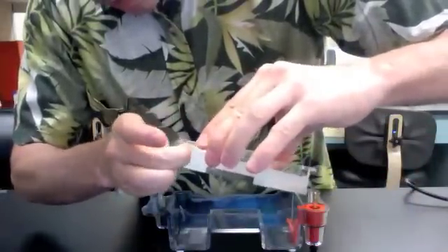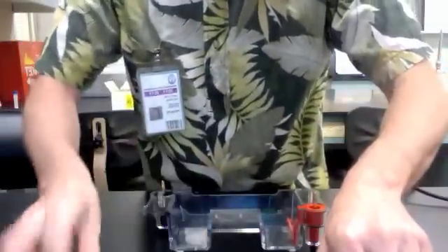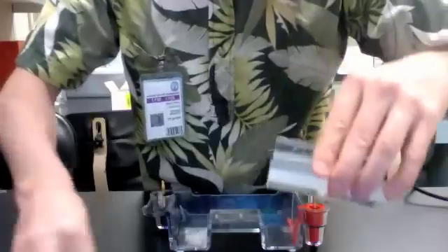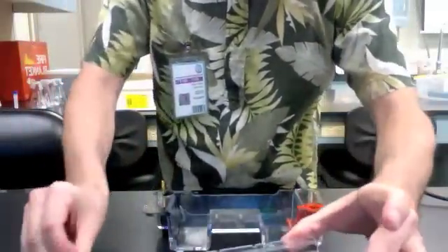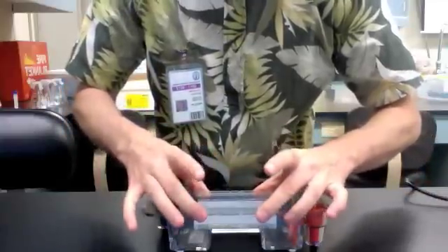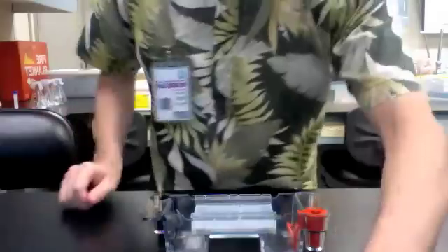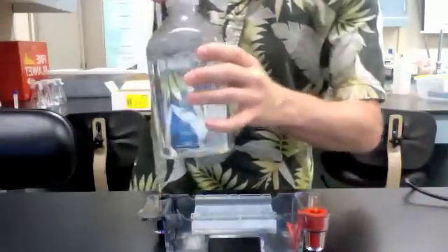This may seem tedious, but by taping it up very well, you made sure that it didn't leak out all over the place, which is important. All the tape has been removed. Now you don't have to take the gel out of the container—you simply place the container like so. Once the container has been set, you're going to take your TAE buffer.